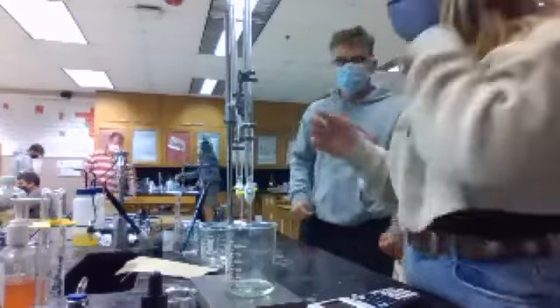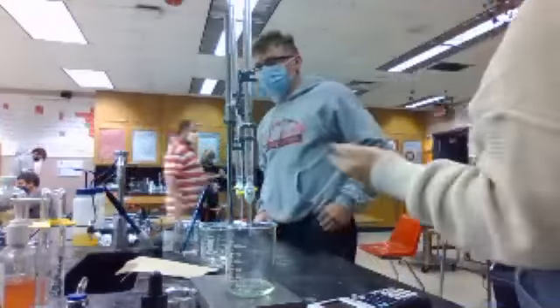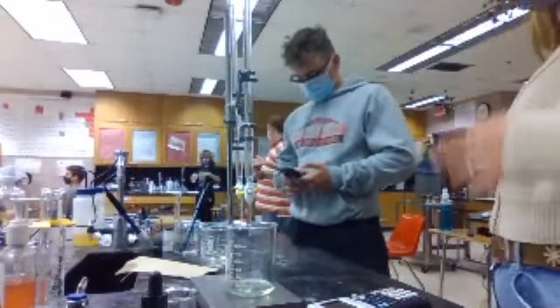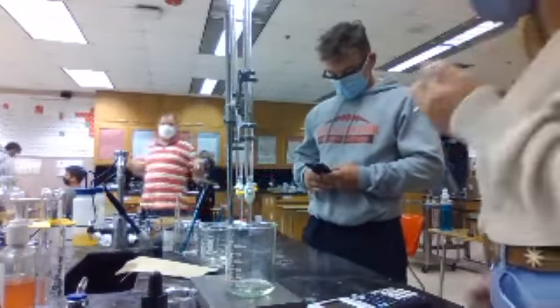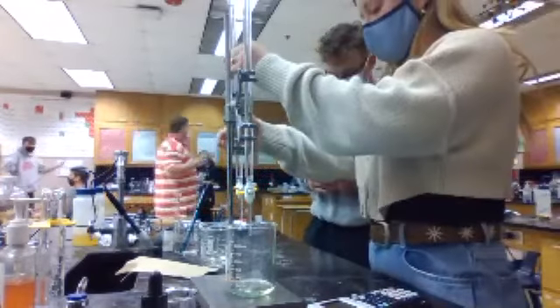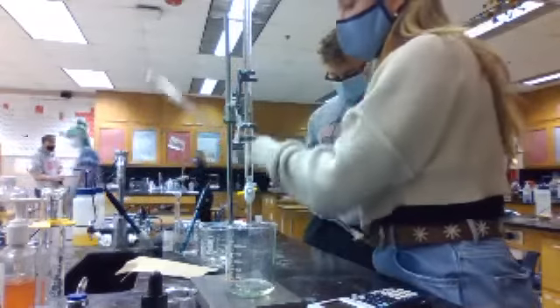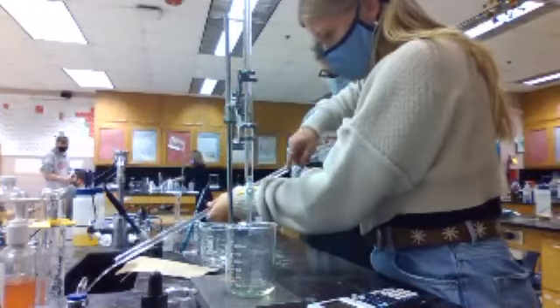Okay, let's clean up. Do we just dump all this? Yeah, that's why you have to be careful whenever you pour your chemicals out each day. Know how much you're going to use. We'll do that one tomorrow.